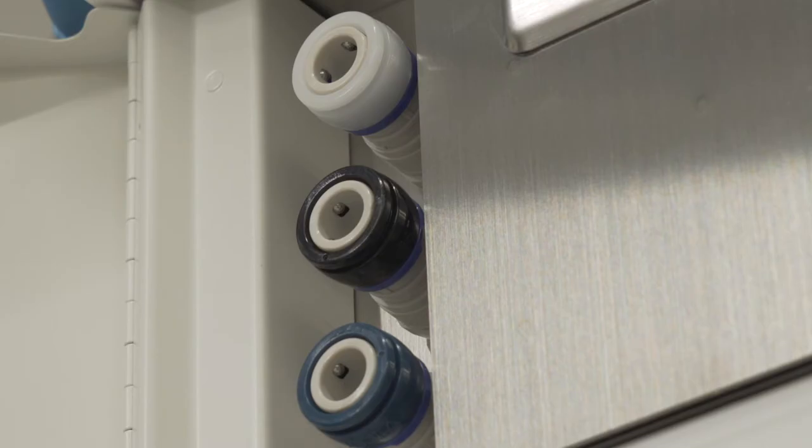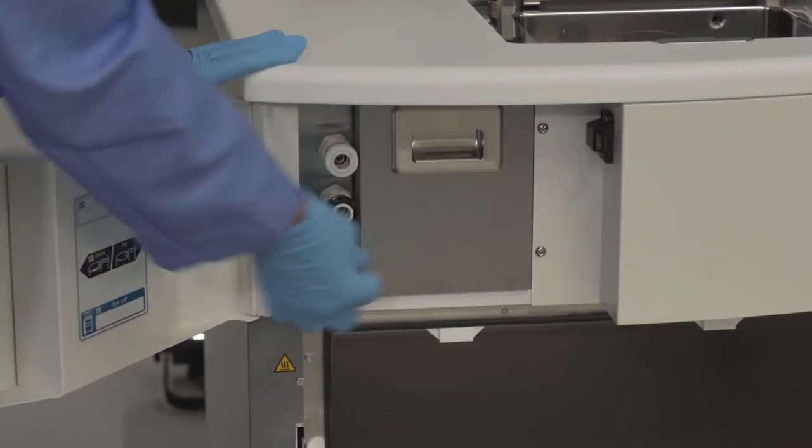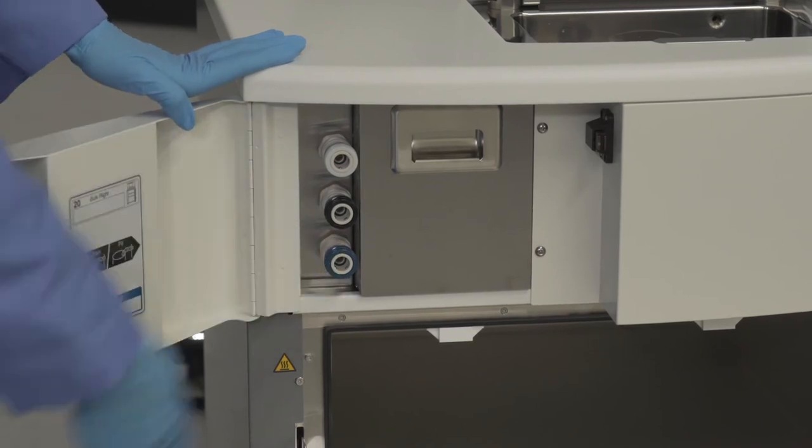Next to the carbon filters you will find the external drain and fill ports. This processor has three ports that allow you to fill your bulk tanks and also fill and drain all reagents from the reagent compartment using hoses that were included with your purchase.